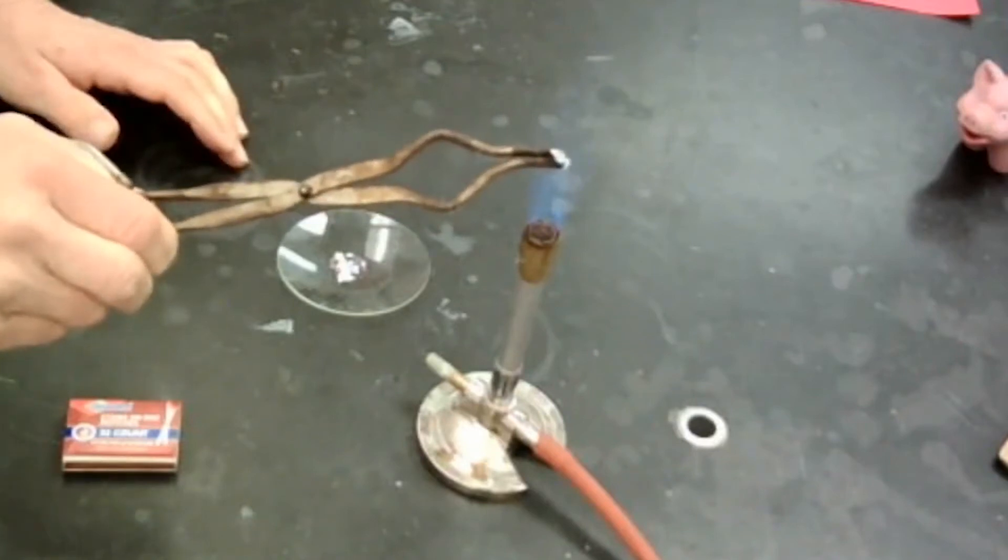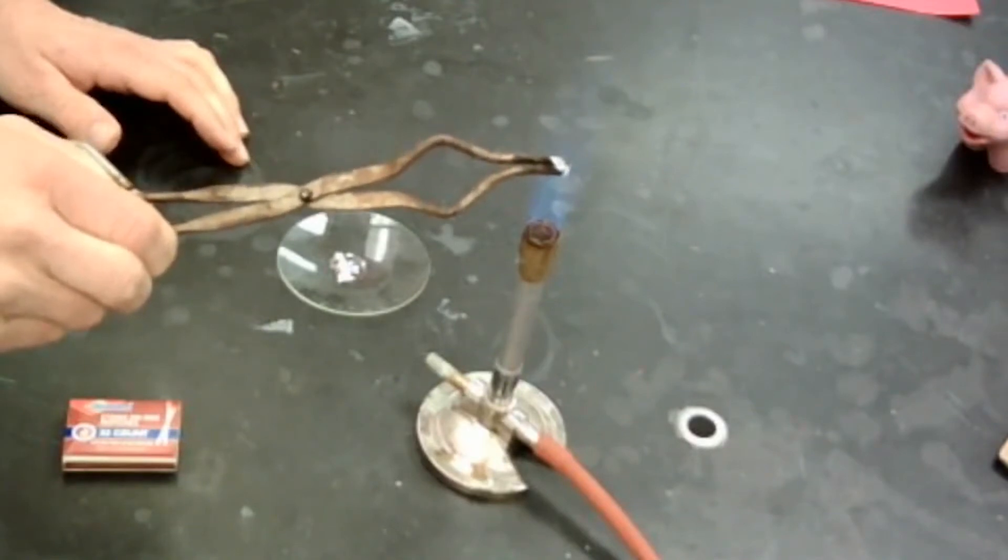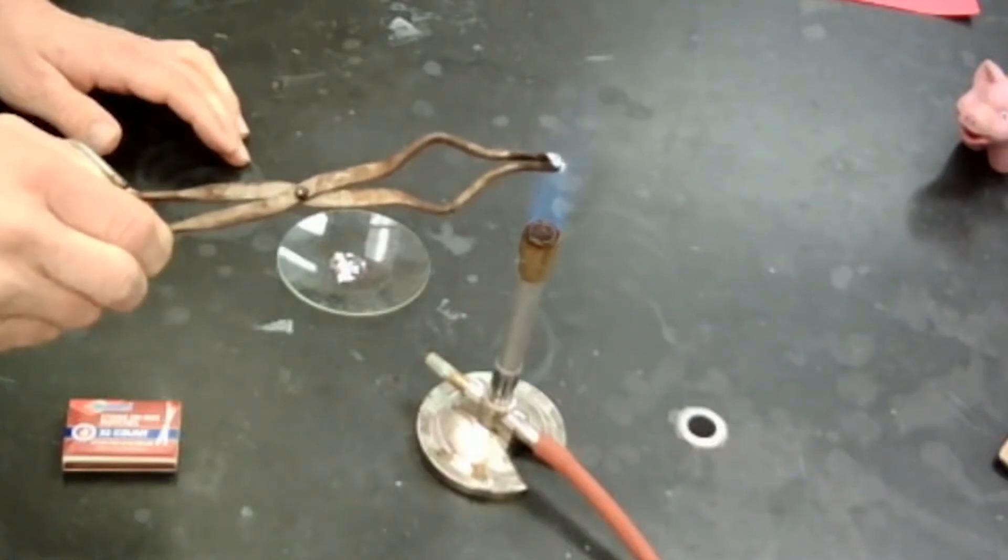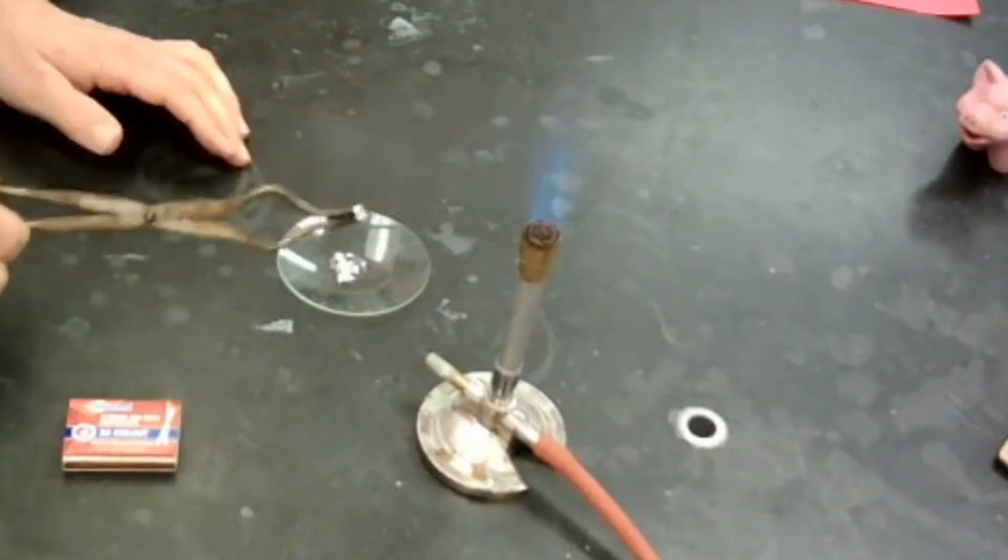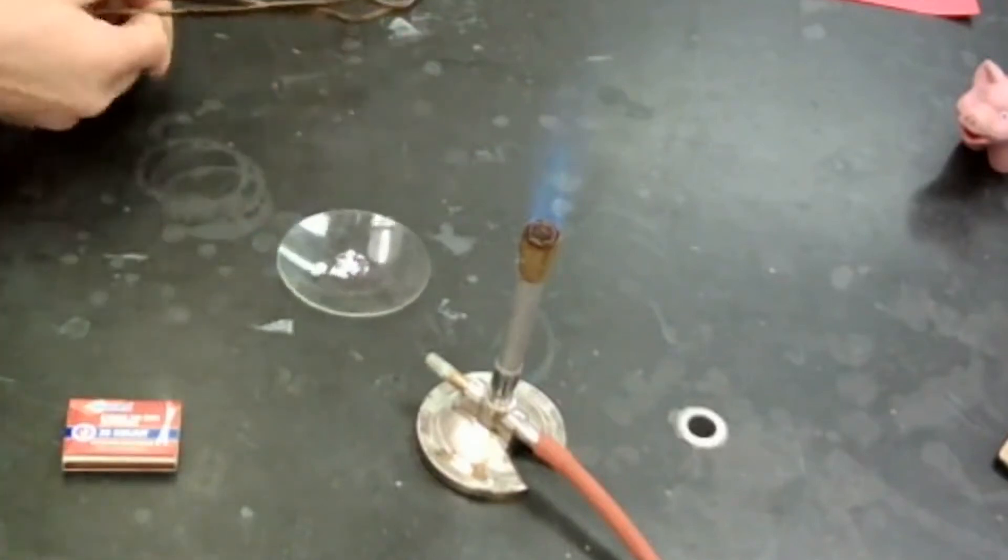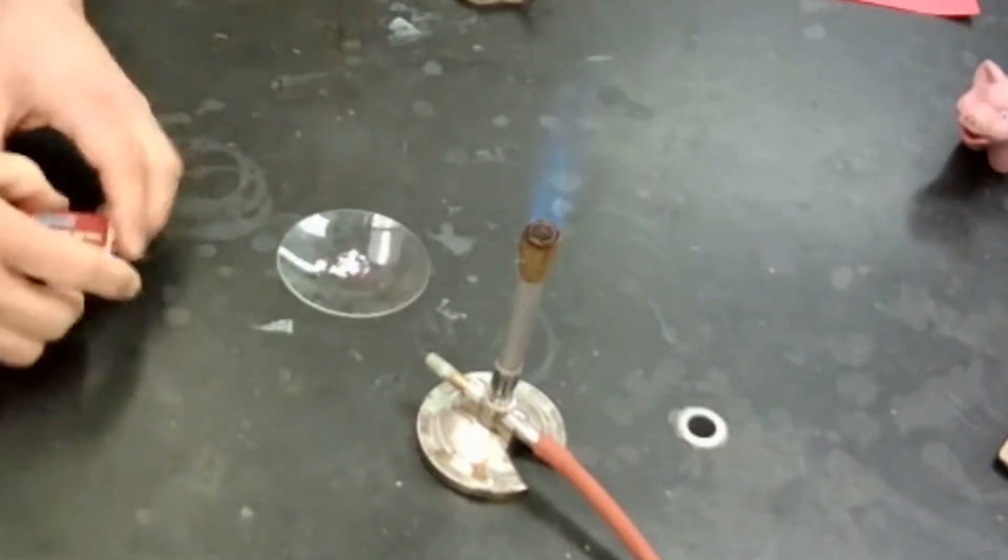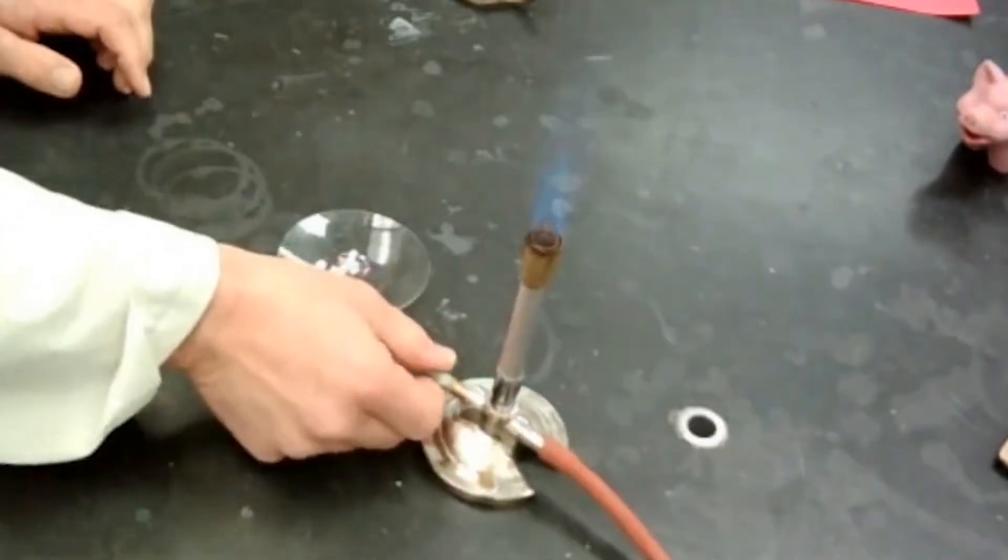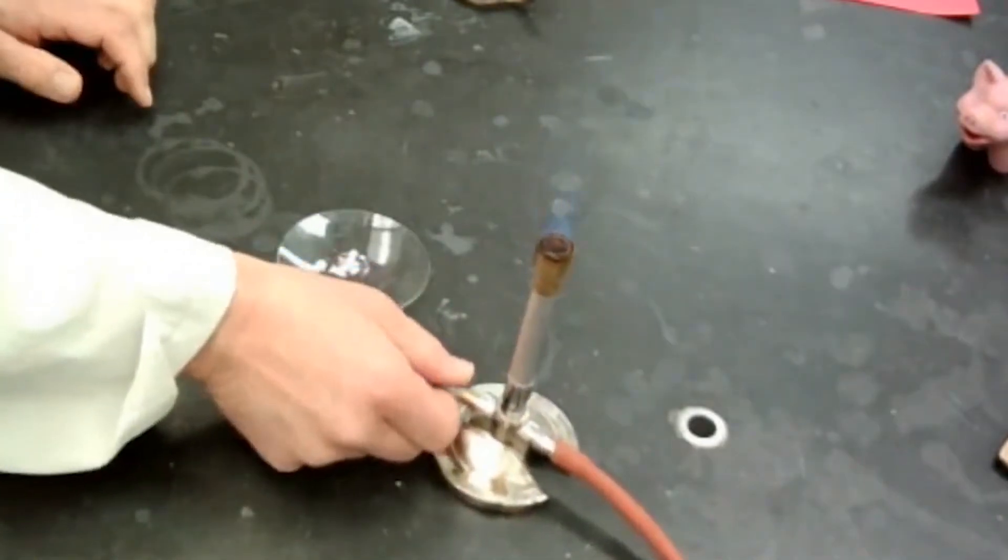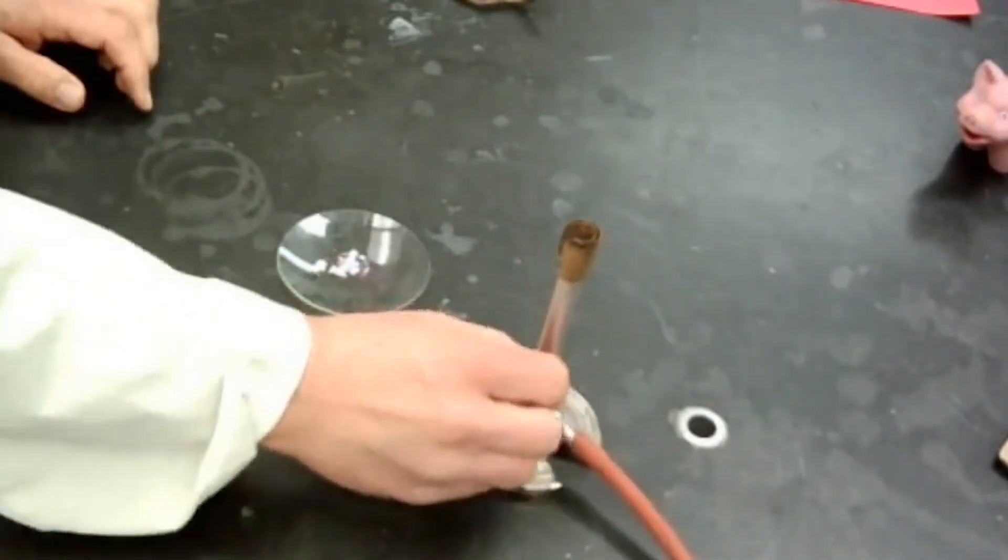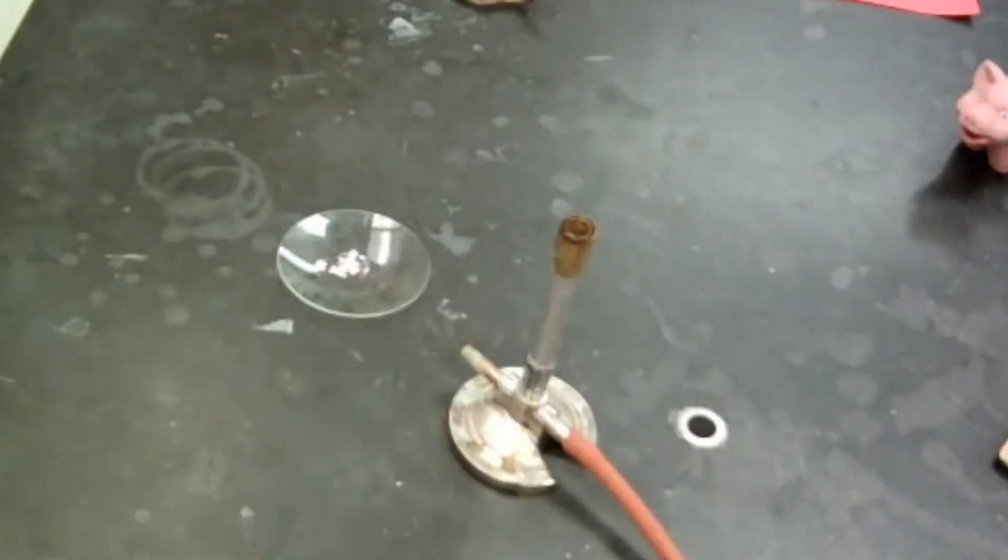Let's see if I can get this to go a little bit more. Maybe I have so much magnesium oxide on the outside, I don't think I'm going to be able to get this to react. Nope. I think we're dead. So like I said, quick reaction, easy to do. I'm going to turn off my Bunsen burner now, and then I'll turn it off with the gas here.